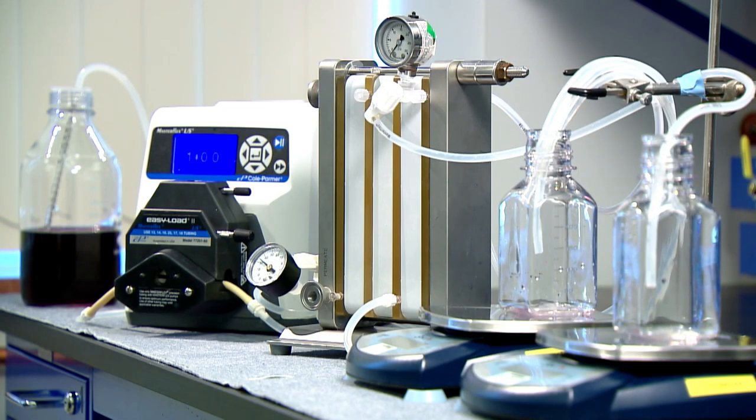Complete your setup by connecting to your feed and pump with feed pressure gauge to your assembly. You are now ready to run.